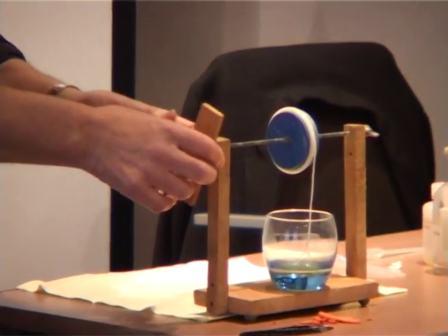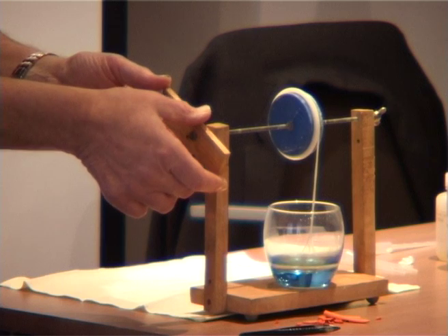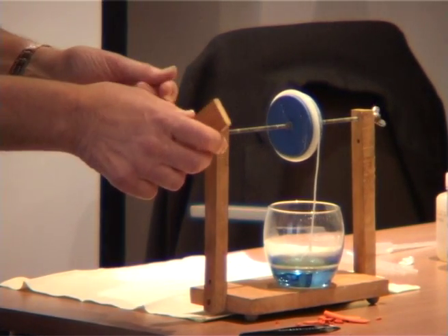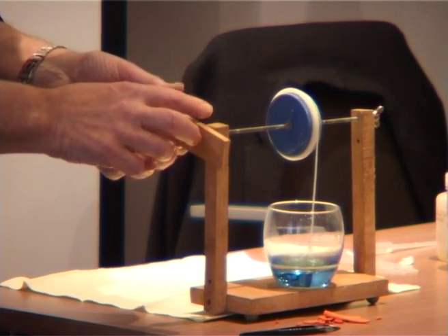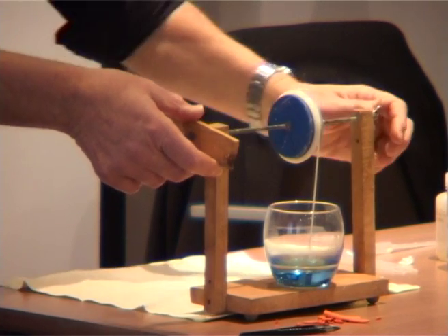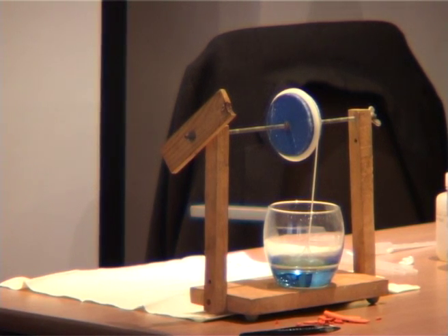Now, I don't want you to think this is one great long molecule I'm pulling out of here, because it isn't. There's many thousands of millions of molecules being pulled out of here. But they're all sticking together to form this sort of coherent fibre from this nylon. It's going to be nylon 610 actually. It looks fairly flexible, doesn't it? That's because it's swollen with hexane. Nylon 610 is not very flexible, and I think I've tightened this thing up so that I can't change it anymore. Anyway, we could go on further. We can go on doing that actually until one or other of the reagents is consumed.